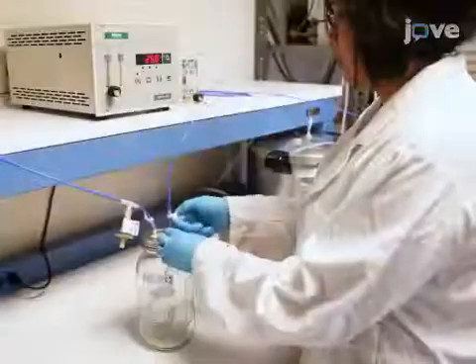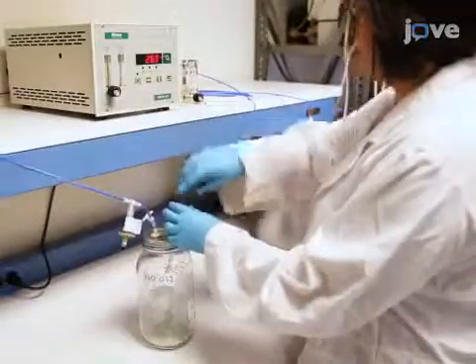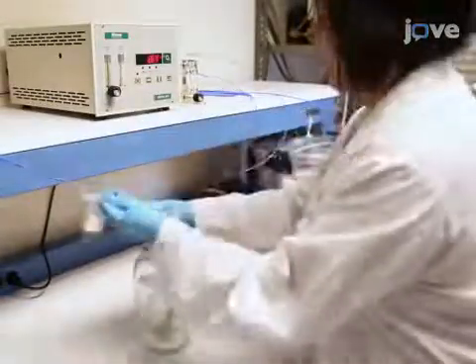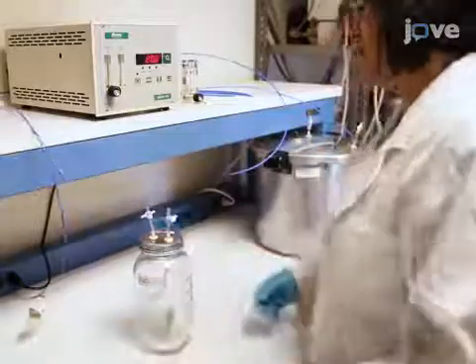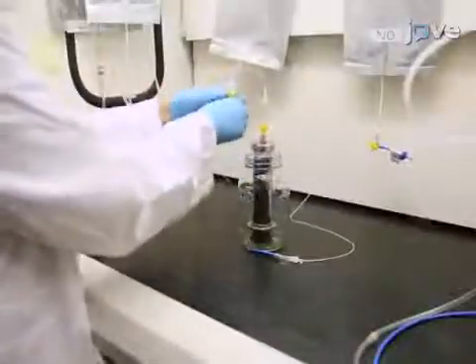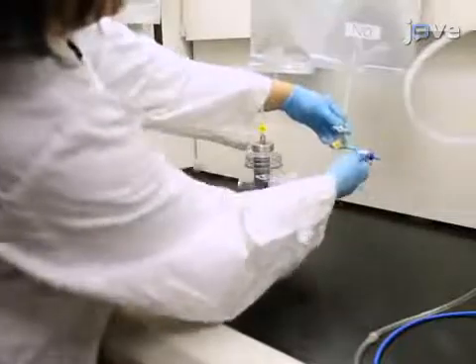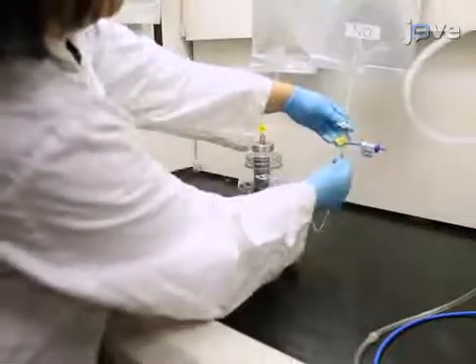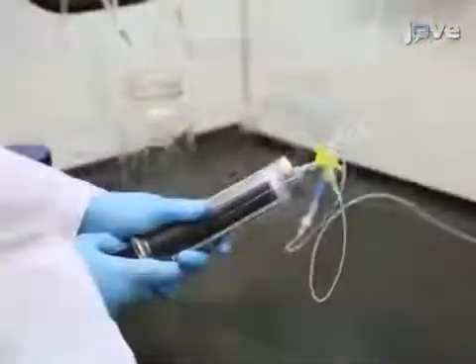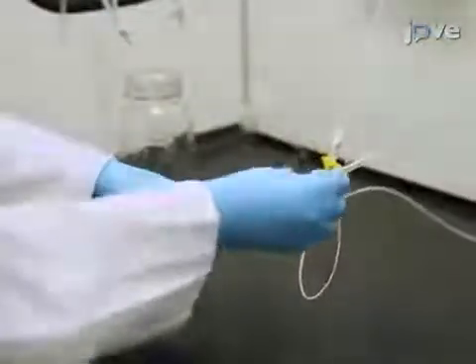When the oxygen drops low enough, close the stopcocks to seal the chamber. Next, prepare the syringe and attached microtubing that are used to deliver the nitric oxide to the chamber. First, flush out the oxygen with nitrogen gas.